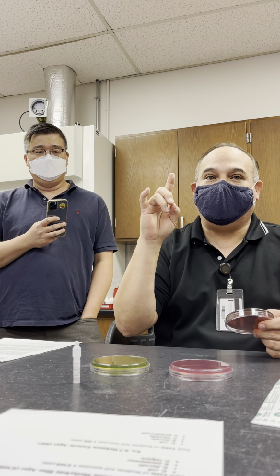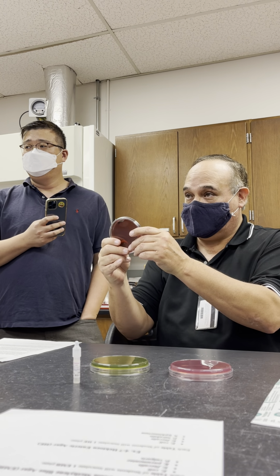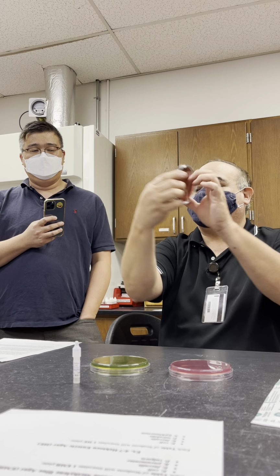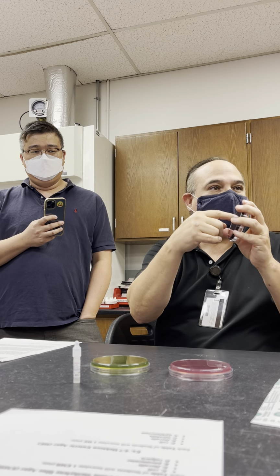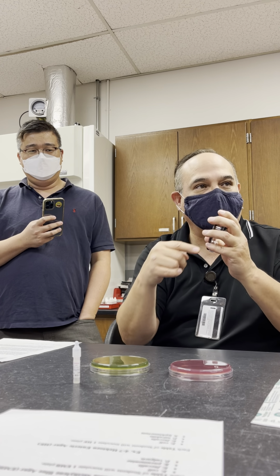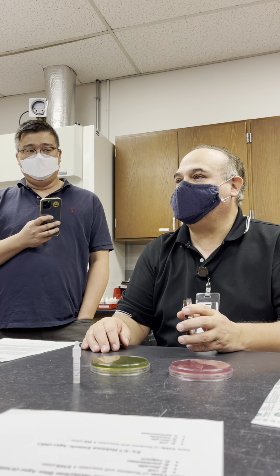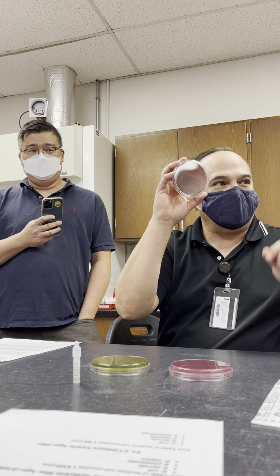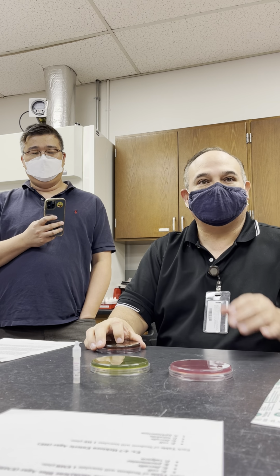Hey, Cheska, will you do me a favor? I'm going to give you a special plate. Your group is all going to do just a normal plate, cut with the Sharpie into 4 equal parts: 1 line for Enterobacter, 1 line for Salmonella, 1 line for Enterococcus, and 1 line for E. coli. But you, if you will please, do a 4-quadrant streak for E. coli so that we can see E. coli on here.